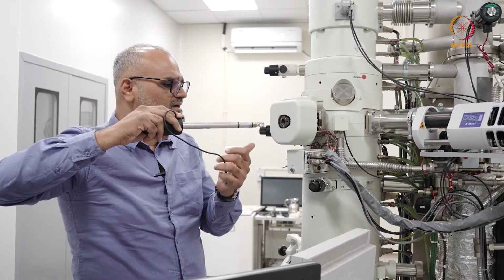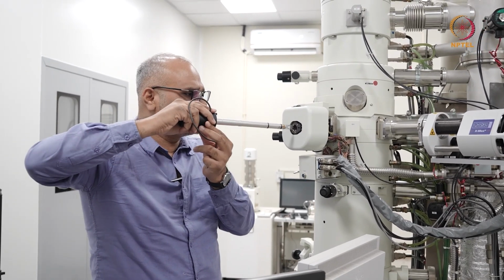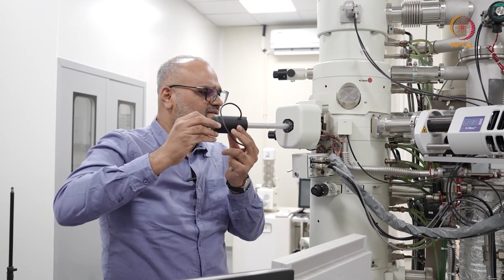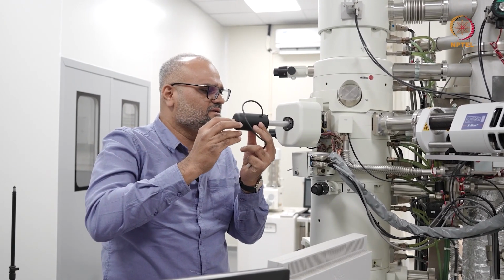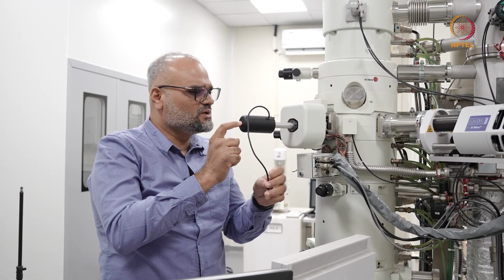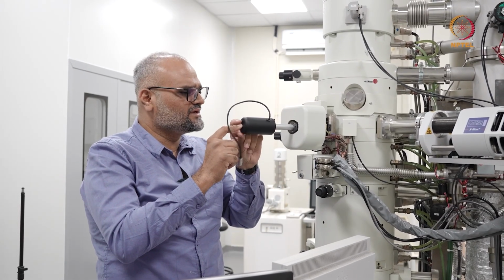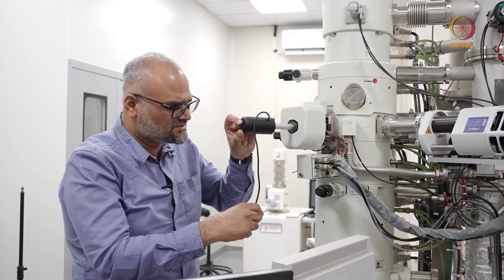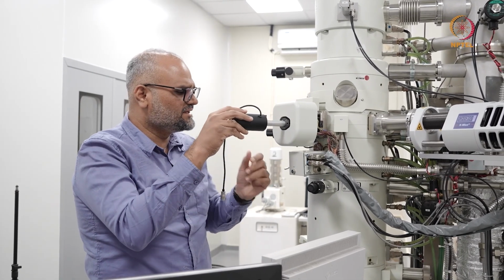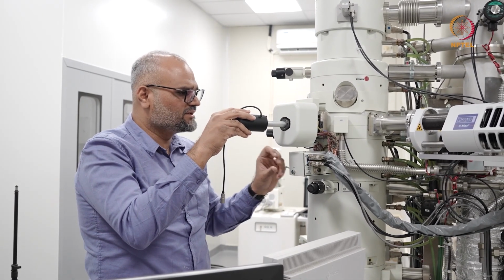So your cradle stays vertical and it goes in carefully. Please be sure that you're not touching any of the tube inside, and it goes in. Once you go there, you just hold it with your finger and you wait to hear a click sound, and you hear those two clicking sounds, and then you can start pumping.